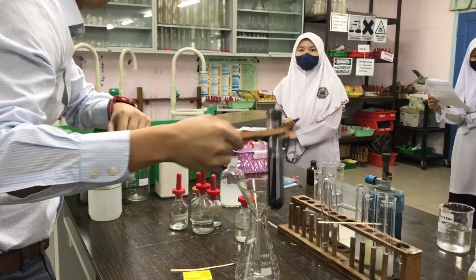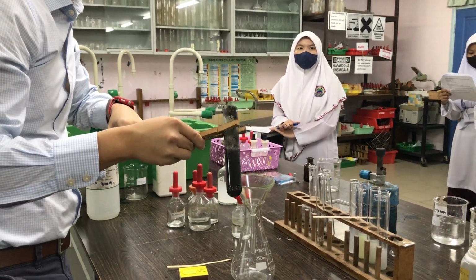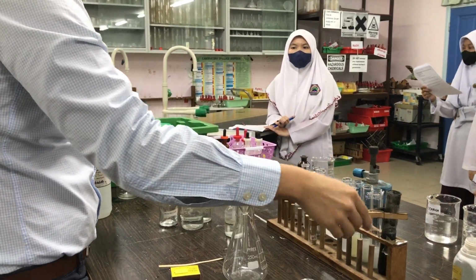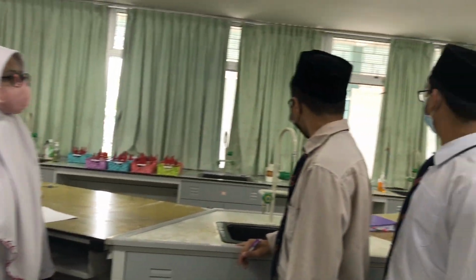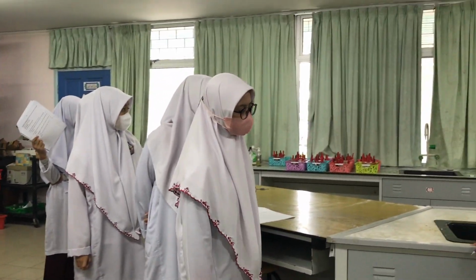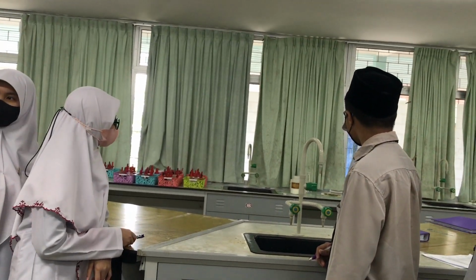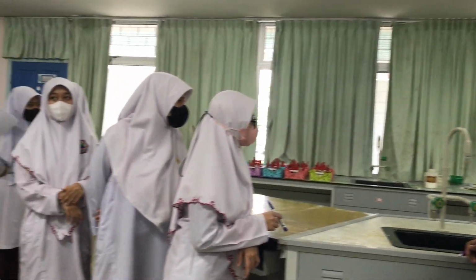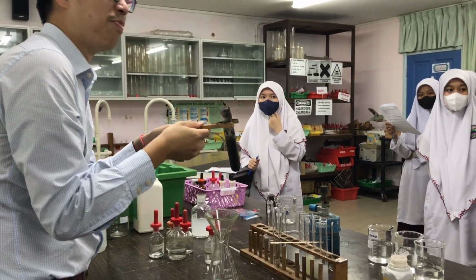Now what do I do? I pour? What's the problem about it? Oh, filter paper. Go and find filter paper, it is somewhere there. Whoever said I should pour the residue, maybe you should think. Next time you drink filter coffee and it is not filtered at all, I don't think you can work in a coffee shop.